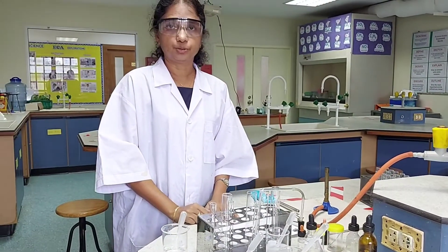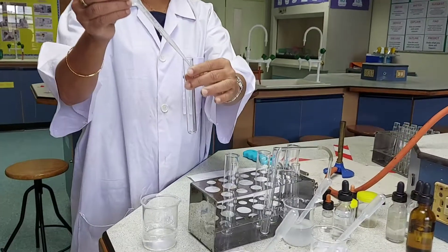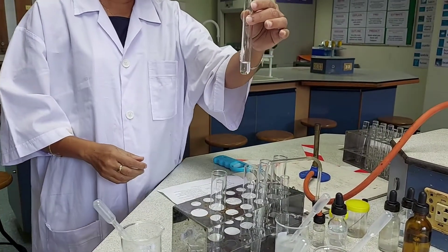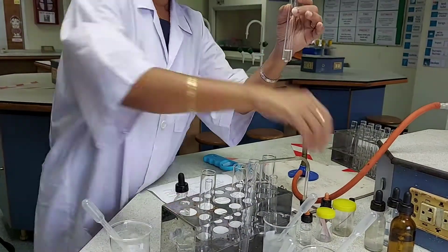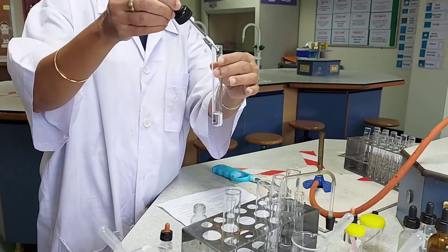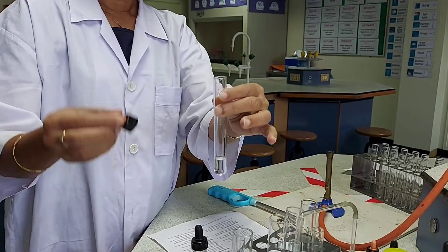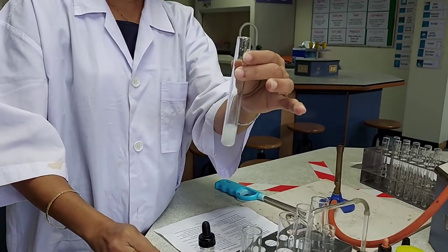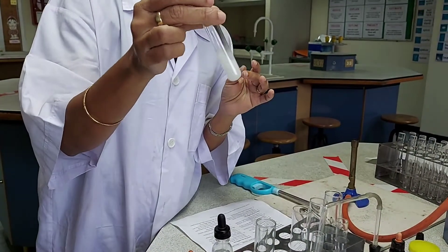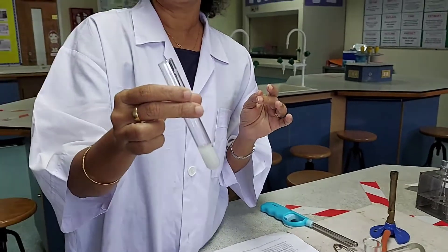In this solution I have the sulphate solution, and I will be testing for the sulphate ion present. I am taking a few centimetre cubes of the given clear solution which contains the sulphate anion. For testing, I will be needing dilute nitric acid and barium nitrate. I acidify the given solution with a few drops of dilute nitric acid, then add a few drops of barium nitrate — a white precipitate of barium sulphate is formed. The formation of a white precipitate with barium nitrate is a test for the sulphate ion.